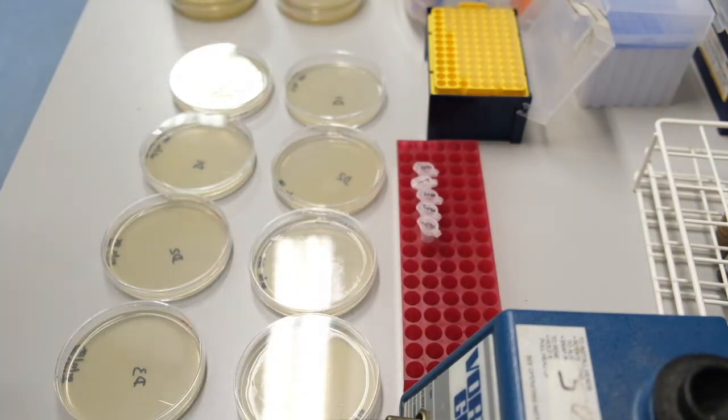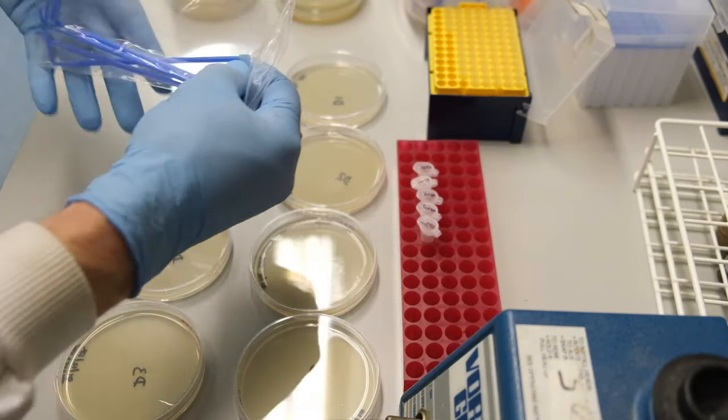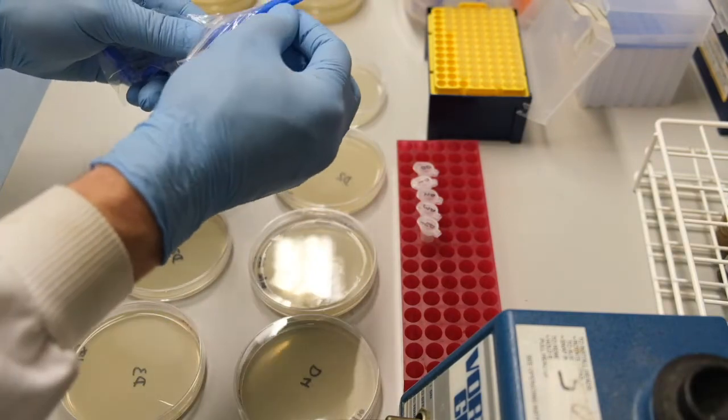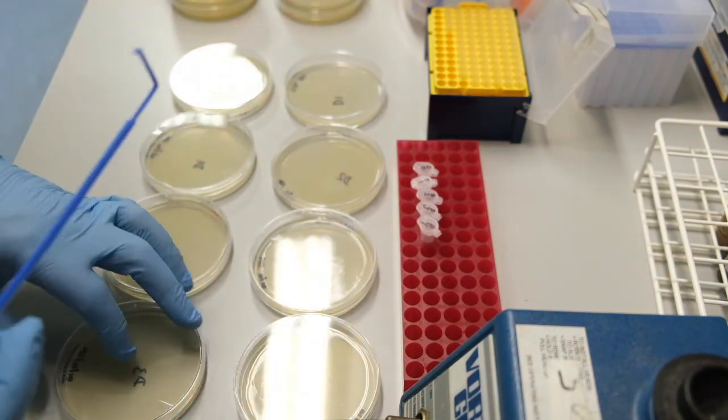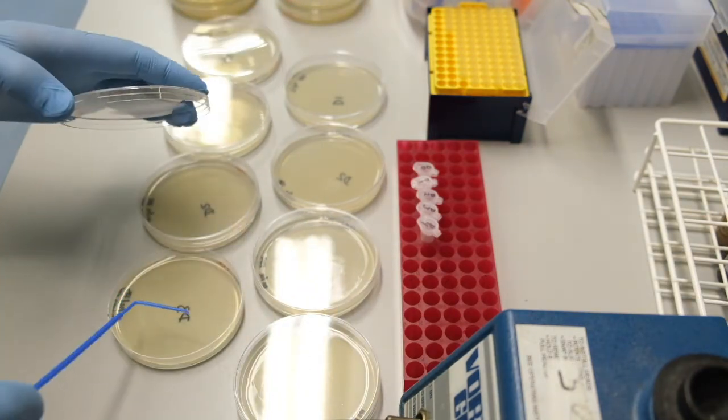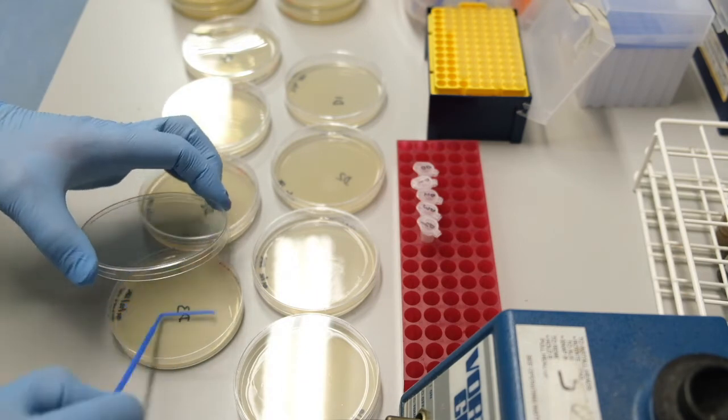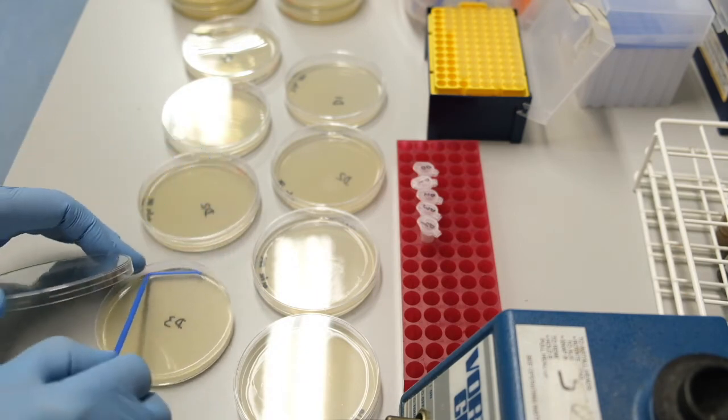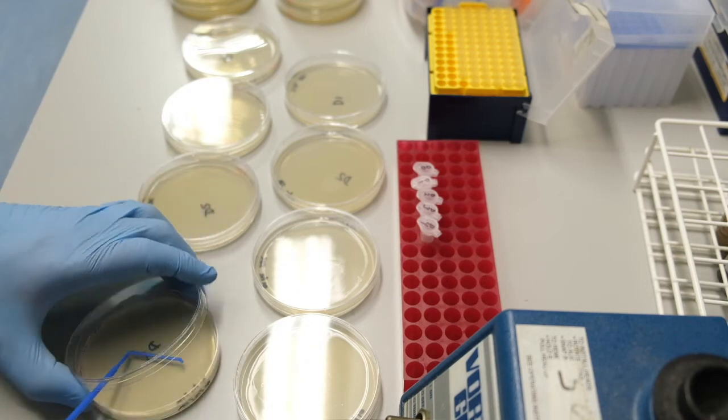I complete all of the plates with no nalidixic acid with one spreader before starting with a fresh spreader on the plates containing nalidixic acid. The process is repeated for all of the plates with nalidixic acid.